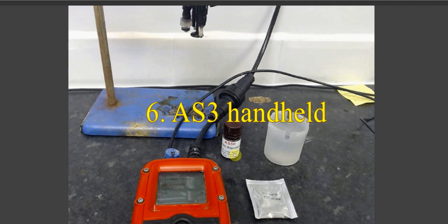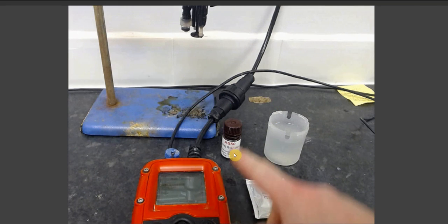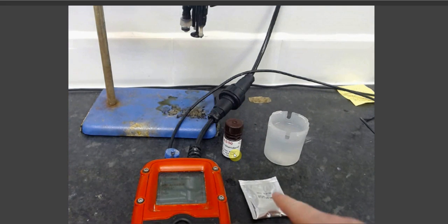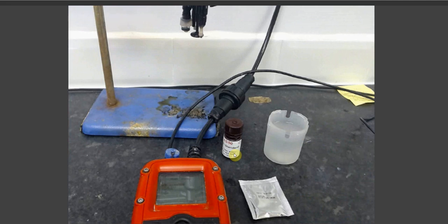For a single point standard addition analysis of arsenic using the Metalyser handheld unit, you will require your handheld unit, your AS50 standard, a HM3 buffer, and 70 milliliters of your sample water in a sample analysis beaker. You will also require your electrodes to be properly conditioned and attached to the sonde.